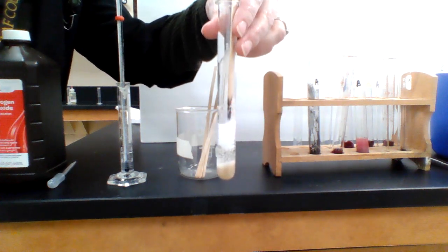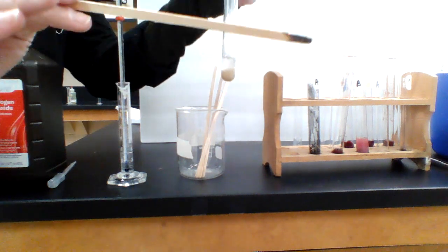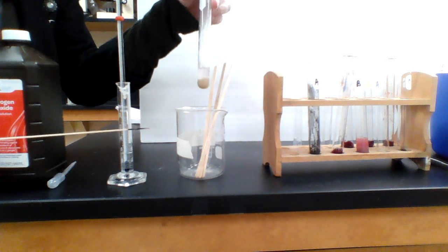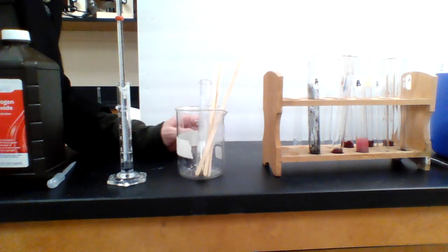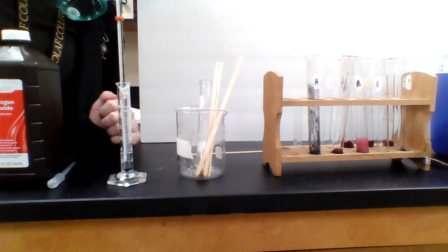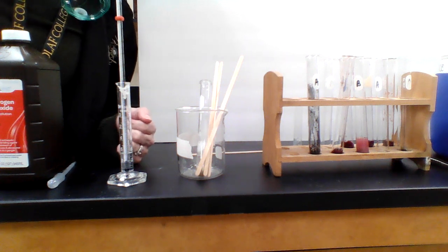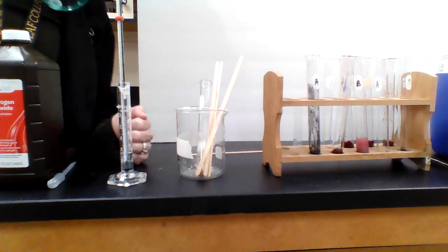I don't know if you could see that, but the splint relit when it touched these bubbles. That's not supposed to happen, so don't write that down. It happened because we had a mistake right at the beginning. So let me be really clear with what you need to write down for your first one, the first sand experiment. The starting temperature was 26. The ending temperature was 26. Bubbles should be 0, not all frothy like it was. And the splint test should be a no. Sorry that turned out funny.